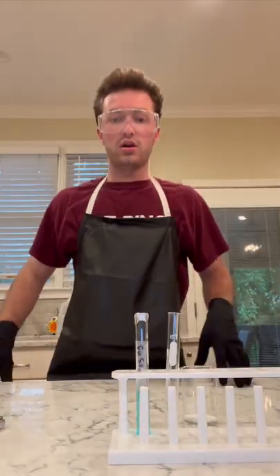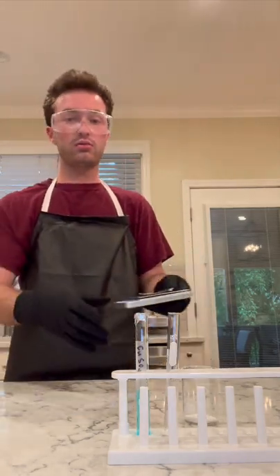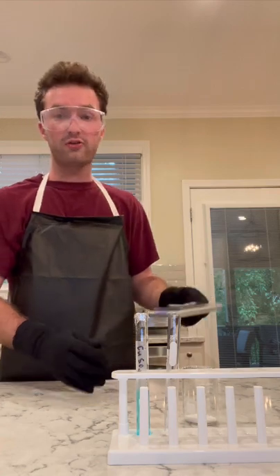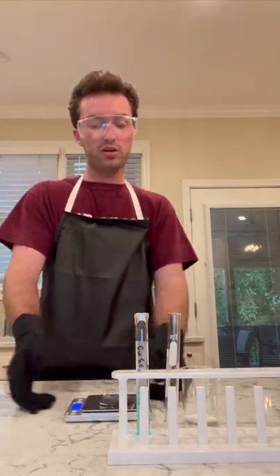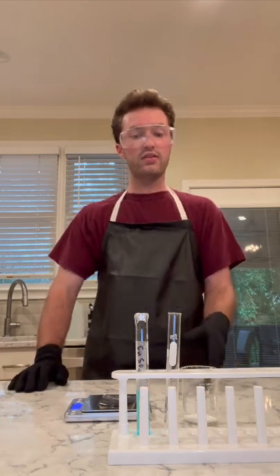Hello, welcome back. So now we're doing part 2 of our first reaction, which is preparing our sodium carbonate, which we have right here. So basically, before I go into fast forward mode, I don't even think you can see. There we go, that's better. So what I'm going to be doing is basically the same thing as last time, except this time I'm going to be measuring out 1.51 grams of sodium carbonate instead of 0.8. So I'm going to do that, and then basically the same thing.